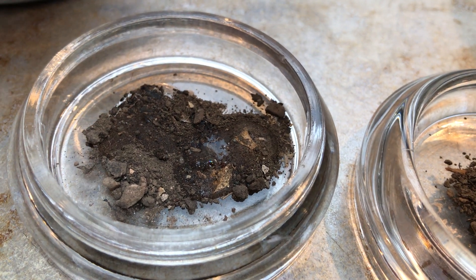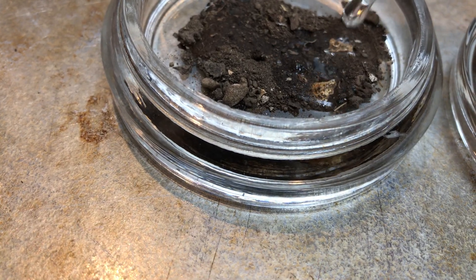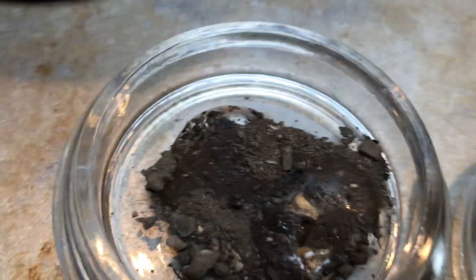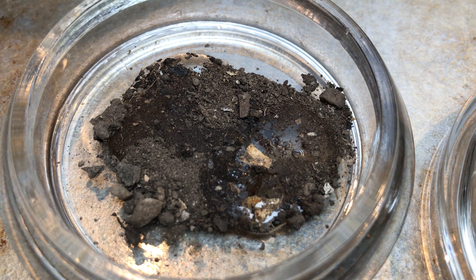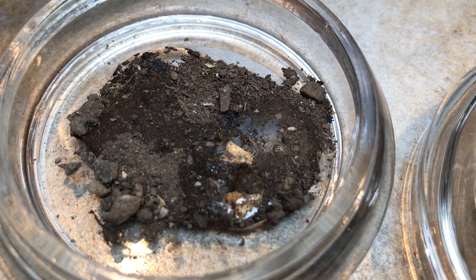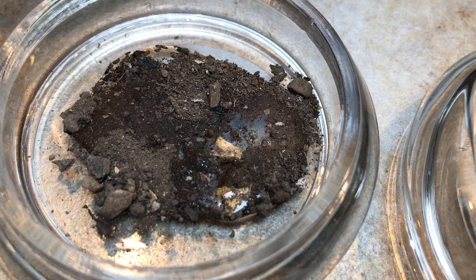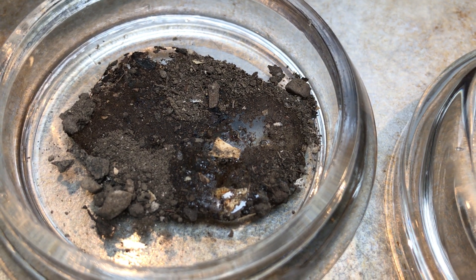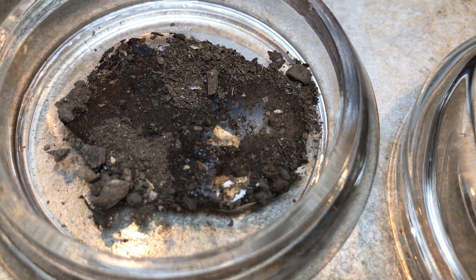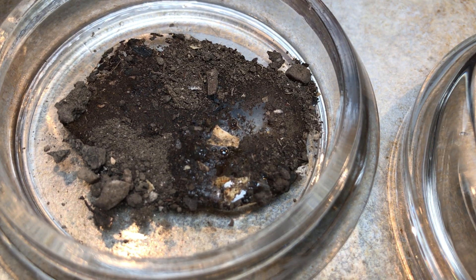Look very closely — fizzing! We do see fizzing. We see some fizzing around that kind of yellow chip, which I believed was eggshell. That makes sense because eggshells are actually chemically identical to the mineral calcite. So because of the fizzing — you can see the little bubbling there — we can say that our crime scene sample is positive for the presence of calcite.